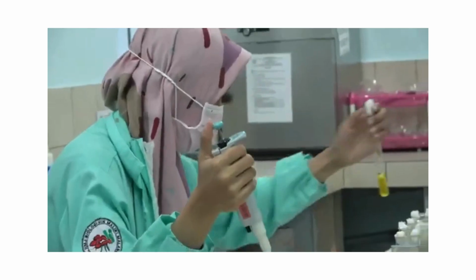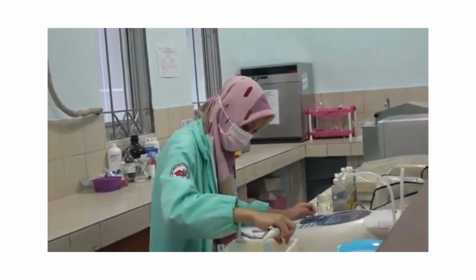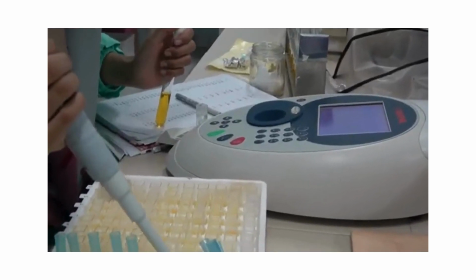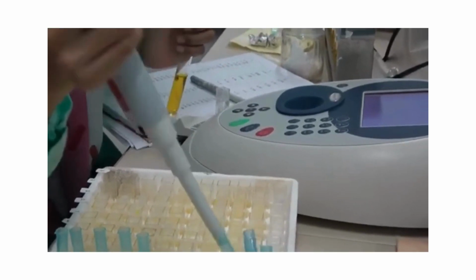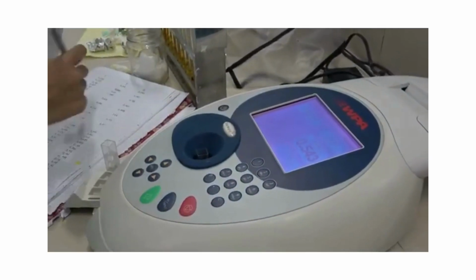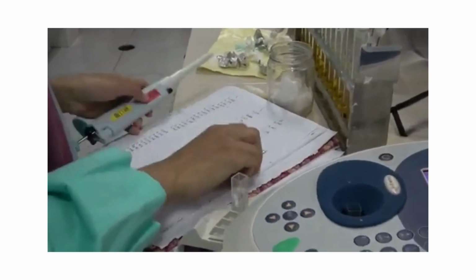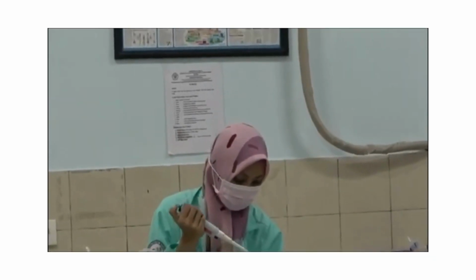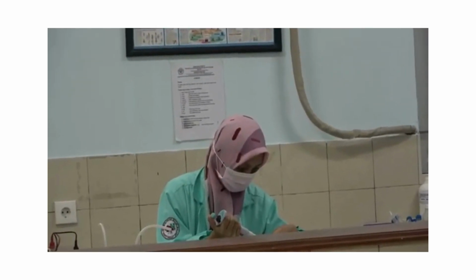The Laboratory of Genetic Molecular Biology is supported by several tools such as centrifuge, PCR, RT-PCR, gel documentation, nanodrop, sequencer, laminar airflow, micropipettes of various sizes, incubator, spectrophotometer, and other general tools. Some of the research being carried out in the laboratory are genetic analysis of banana, genetic analysis of soybean, genetic analysis of kosambi, genetic analysis of some bacteria, and RNA analysis of lymphedemic rats.